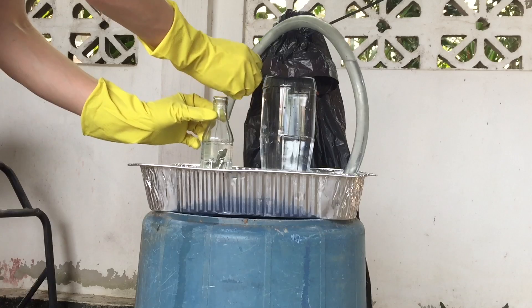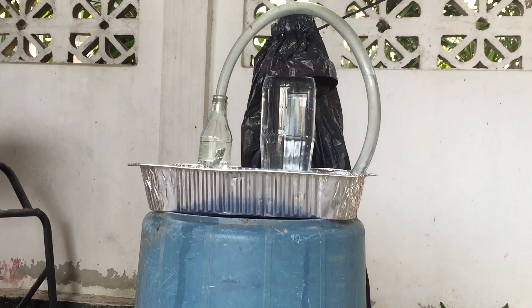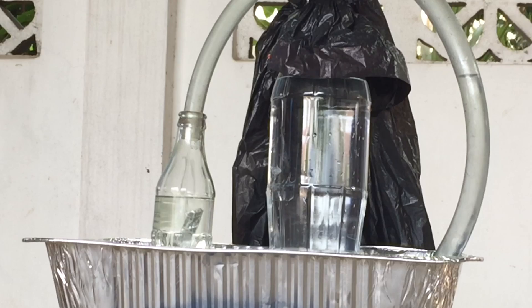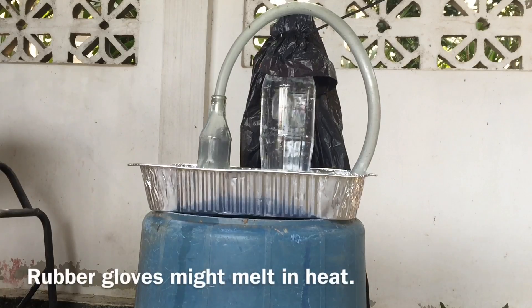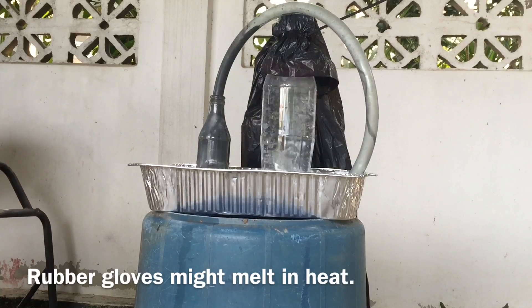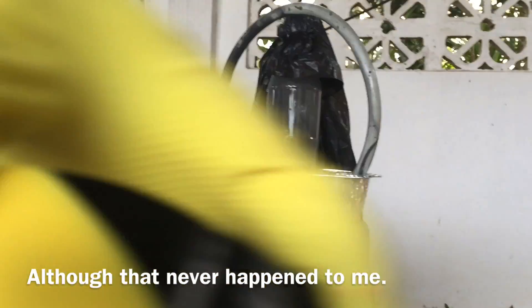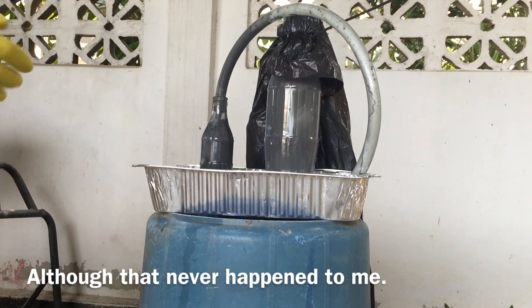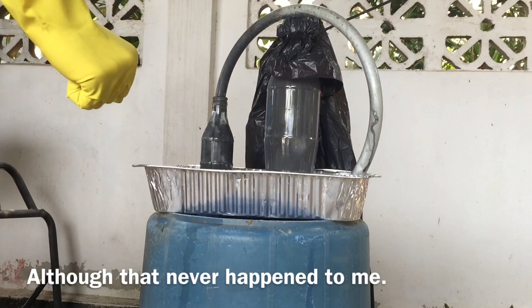I quickly put the tube back on, but the problem was I had way too much hydrochloric acid in that bottle and totally underestimated the reaction power. Within about thirty seconds the reaction really starts taking off — the acid level was way too much and it starts bubbling over, the reaction is like out of control. But don't worry, no acid got inside the trash bag, everything was contained.